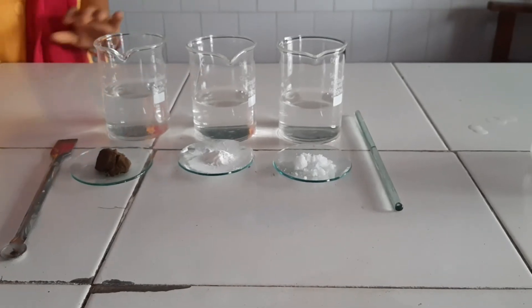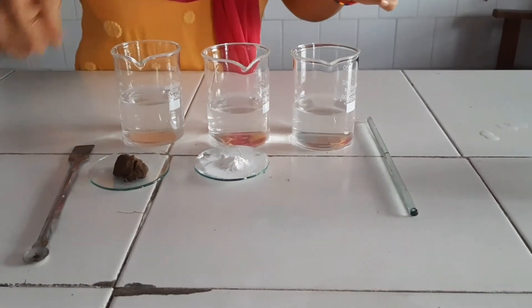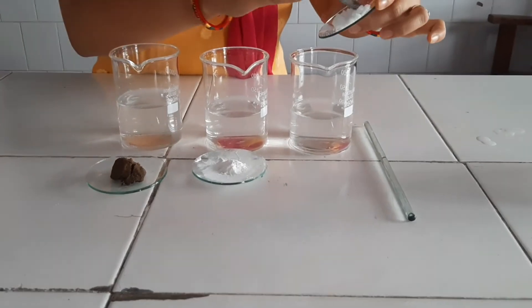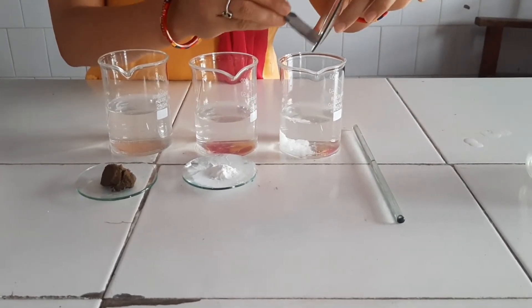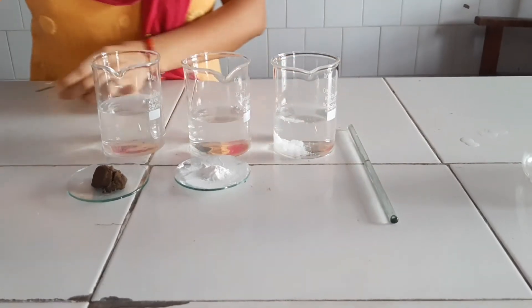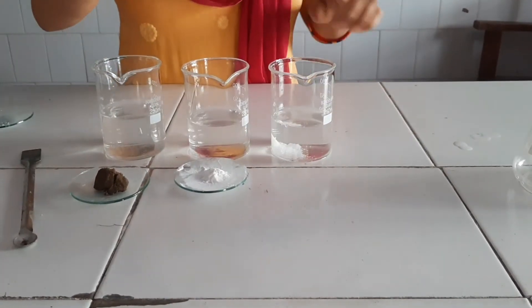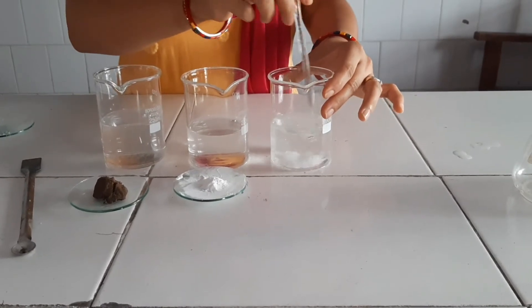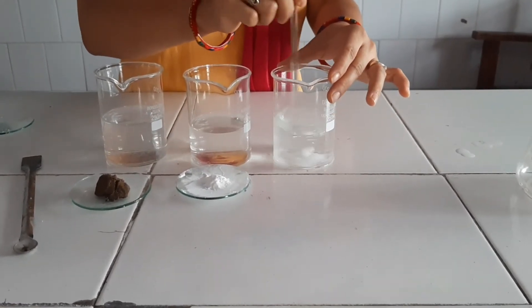Let us take the first sample. This is the zinc sulfate that we are going to add to the water. With the help of this we will prepare the true solution of zinc sulfate. Now we are going to dissolve this substance and we will see that it will be completely soluble in the water.